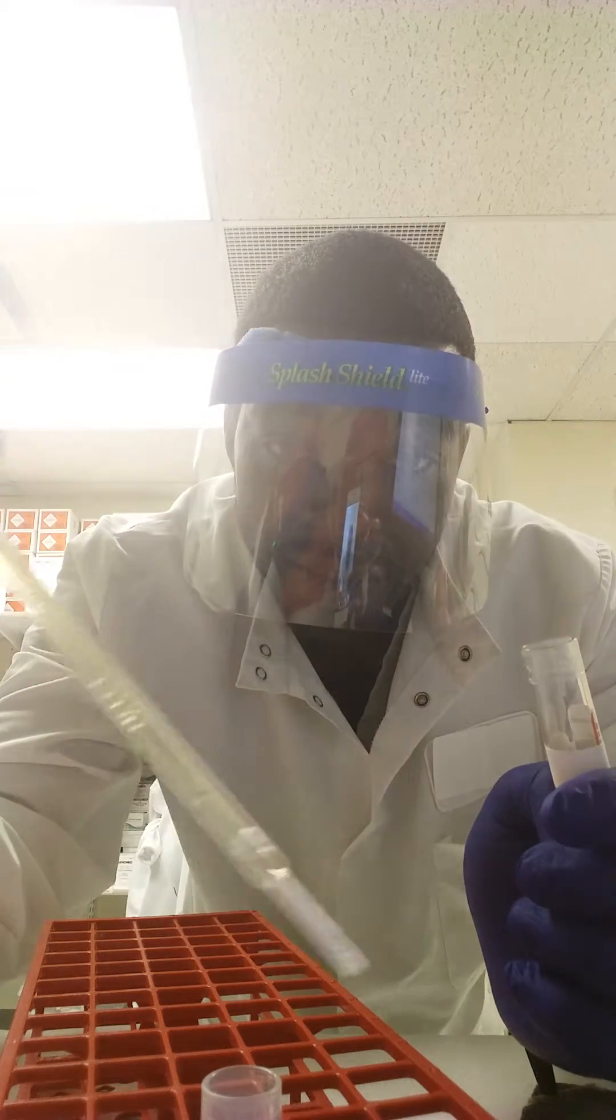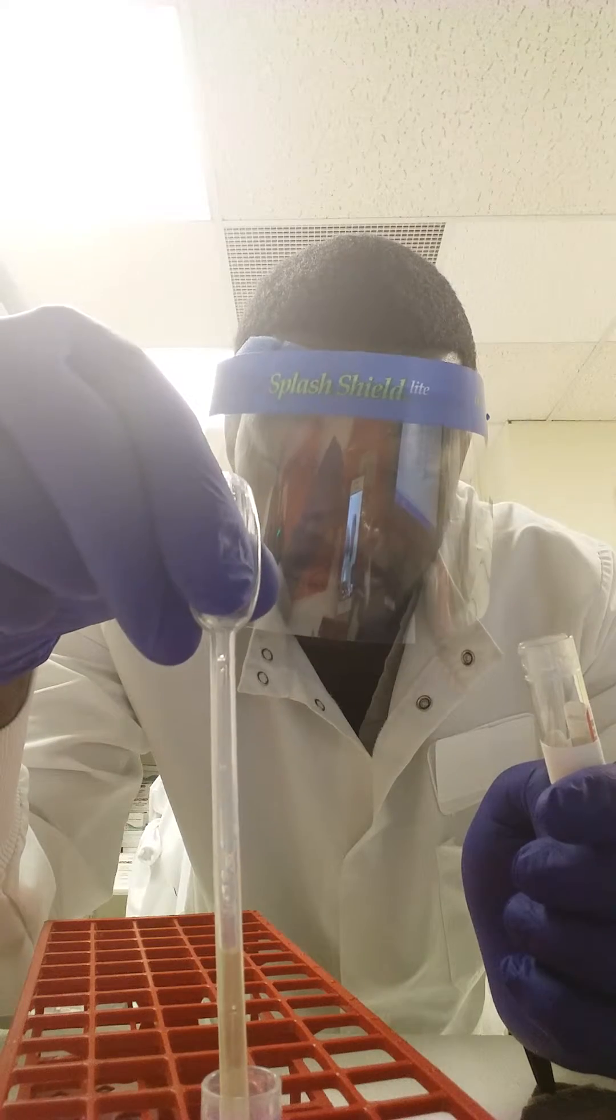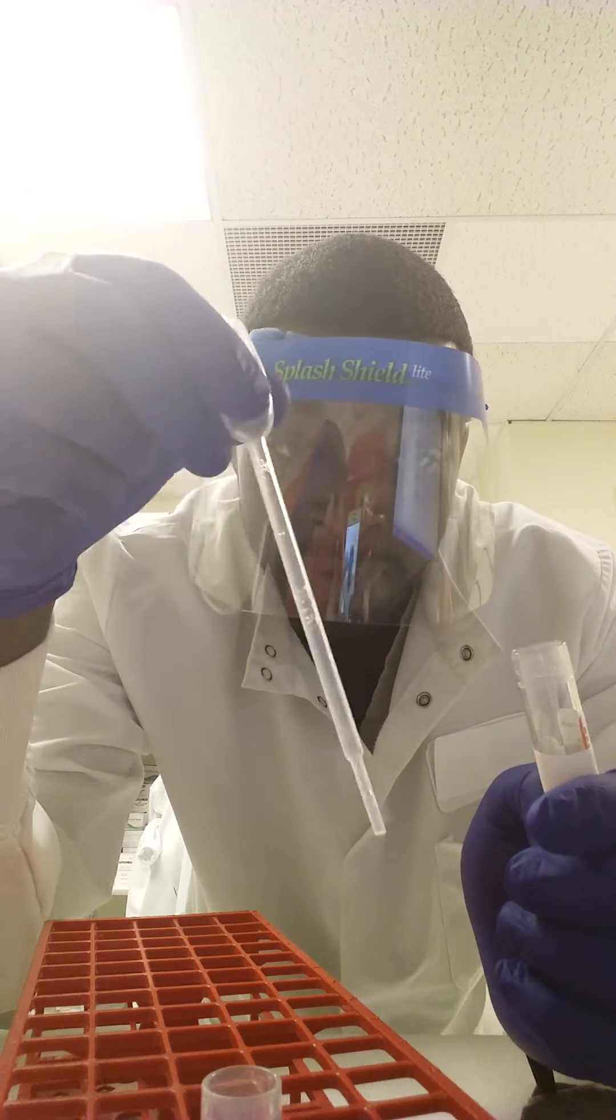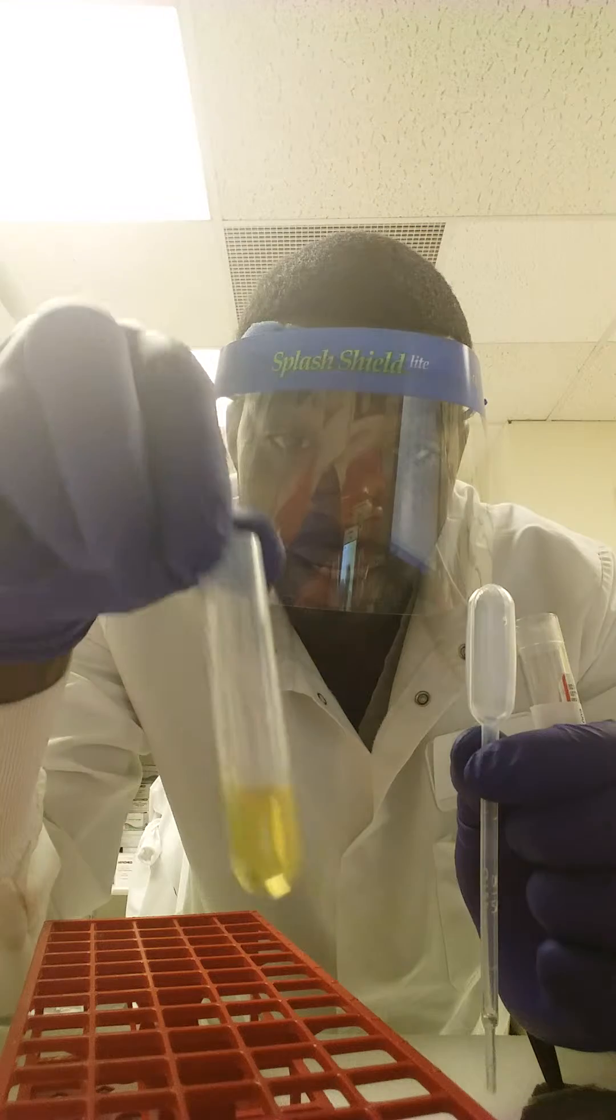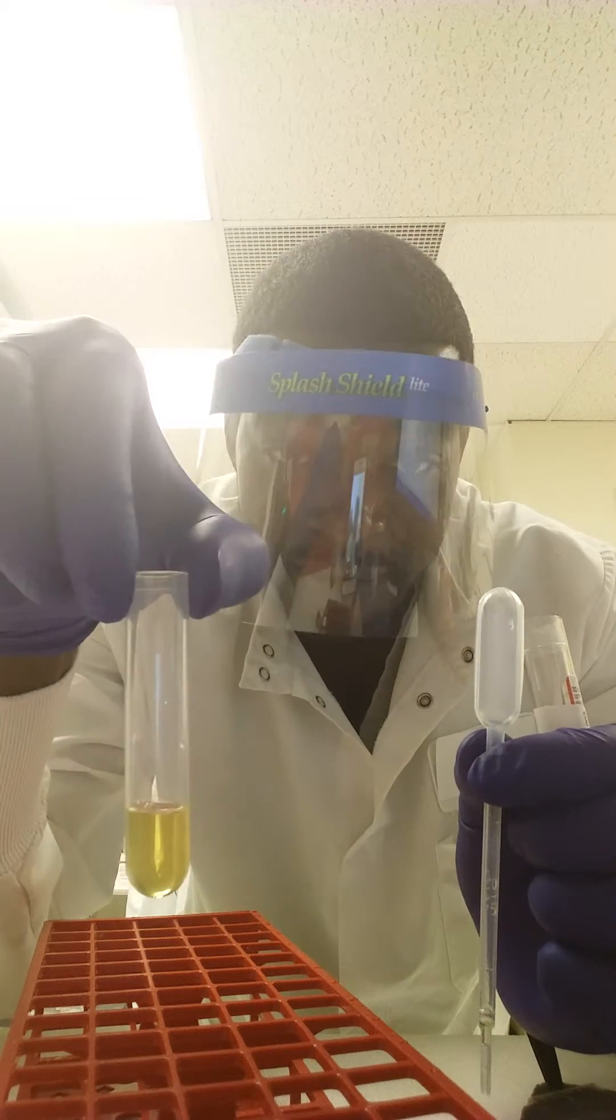And as you can see, there's your serum and you just pour it away. And there's your serum, this is what's going to be tested.